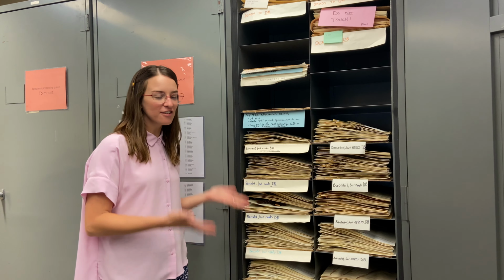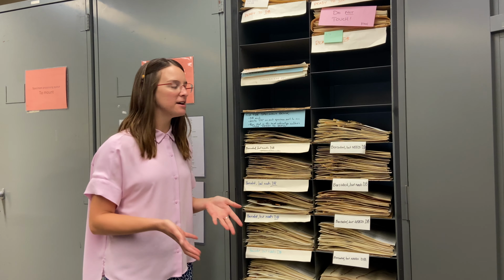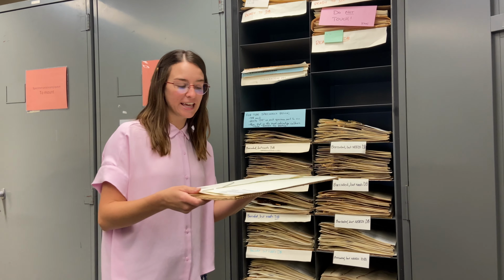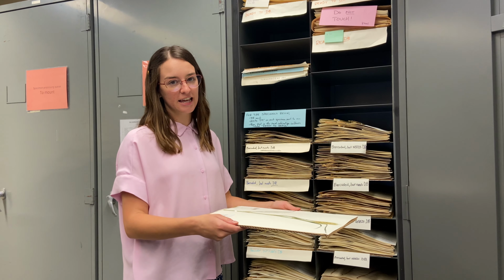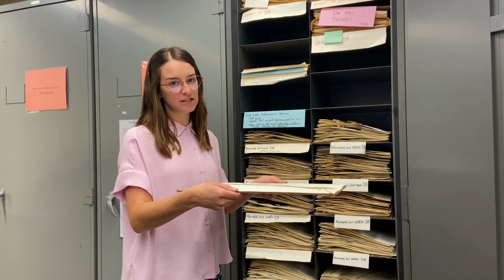As you can see, there are lots of specimens that need databasing. So we'll go ahead and get started with the specimens on the top. And we'll go ahead and begin. And also remember your proper specimen handling techniques. Always use 2 hands and keep them flat when transporting.